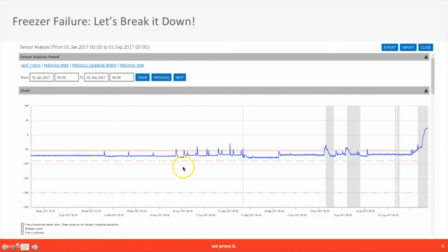Next, over time we see temperature spikes that become frequent and erratic. They are also breaching the alarm zones. This could indicate that the freezer is having difficulty maintaining proper set points and may now require maintenance. In this section, temperatures are running cooler and then warmer than normal for quite some time. And then of course we see some more erratic temperature spikes. These are all clues that it might be time to have your freezer maintained or to remove your samples.